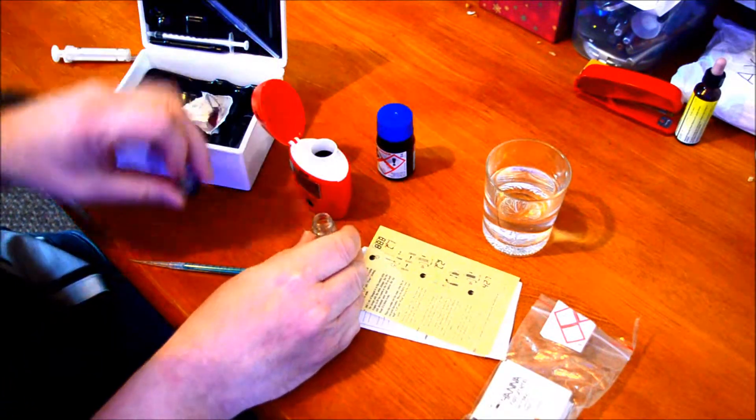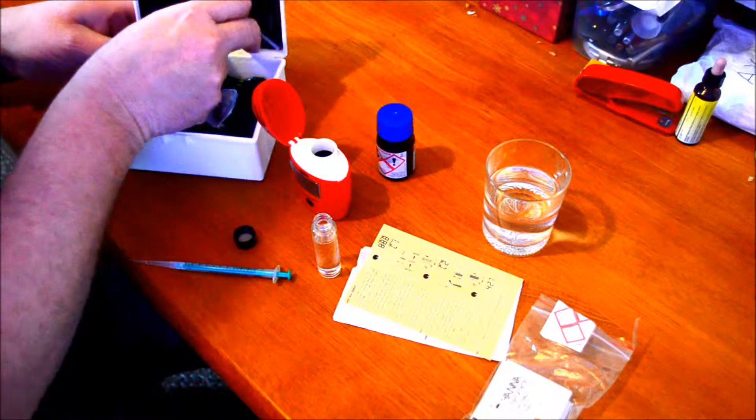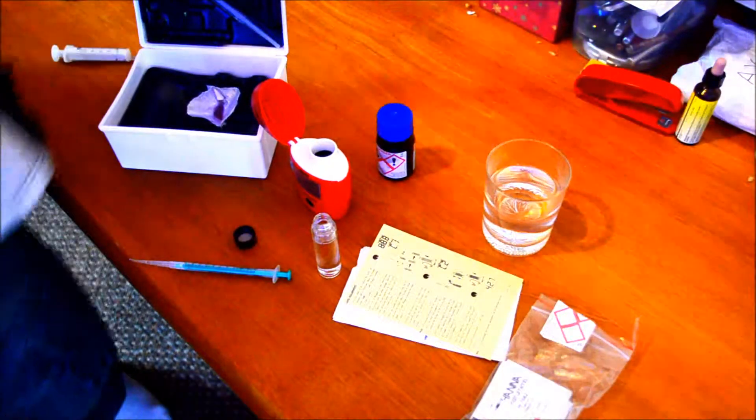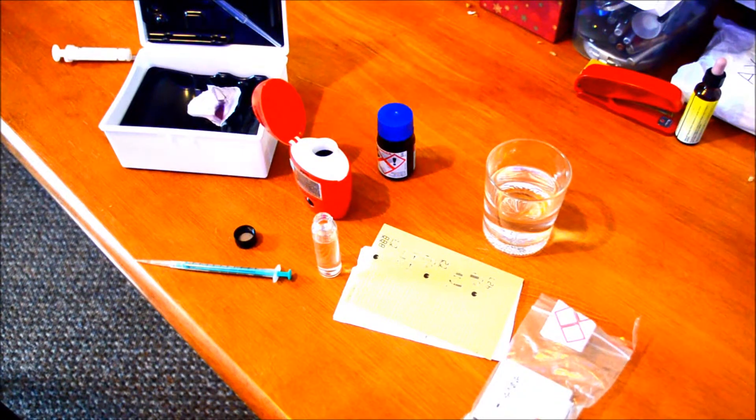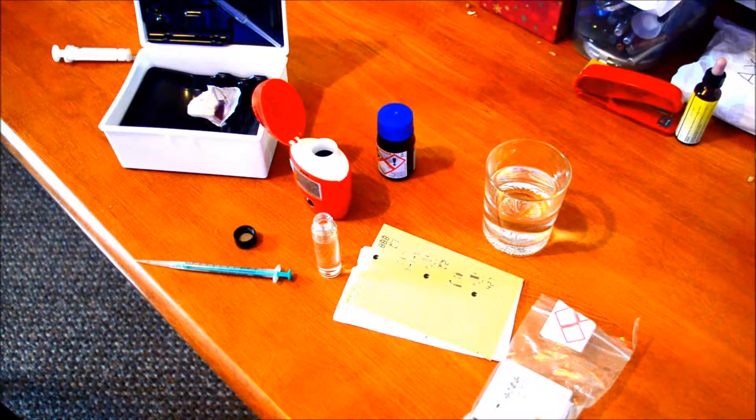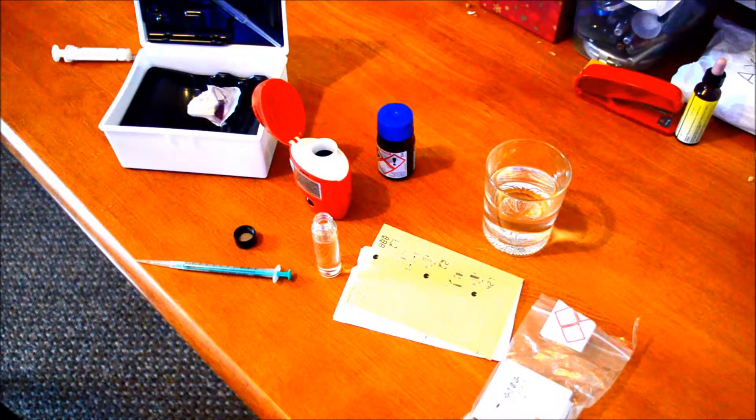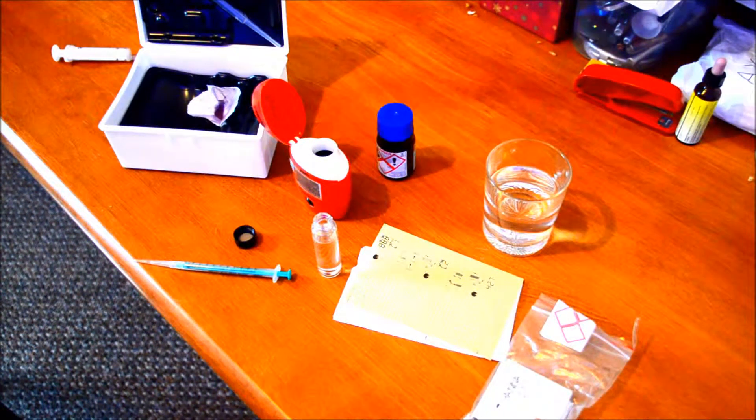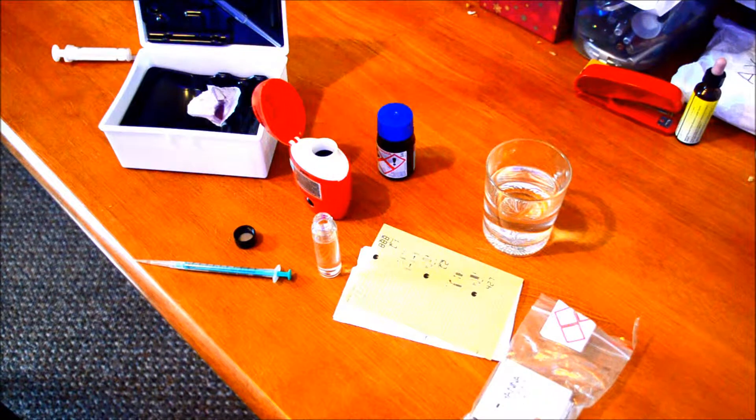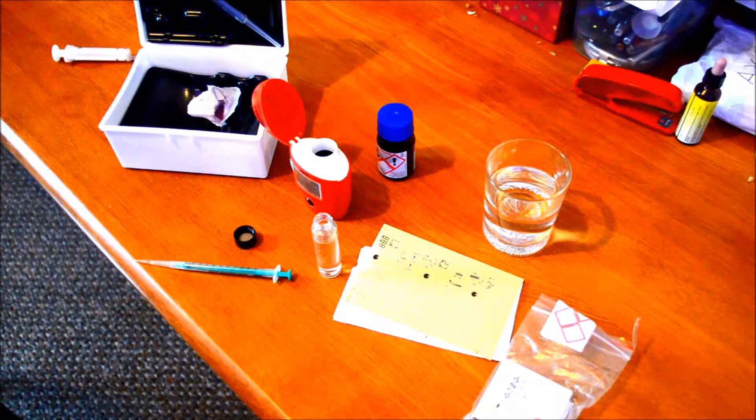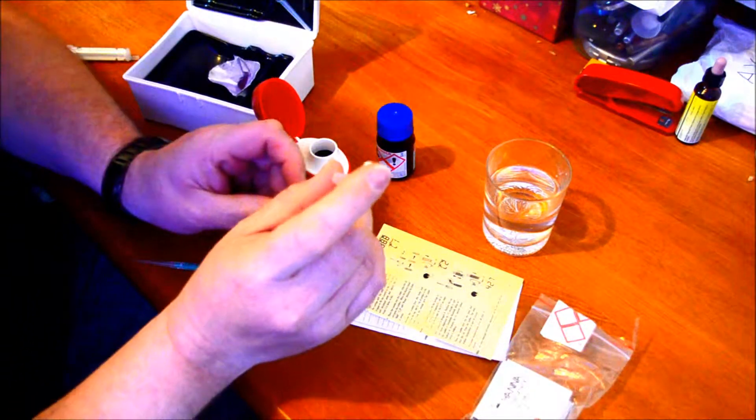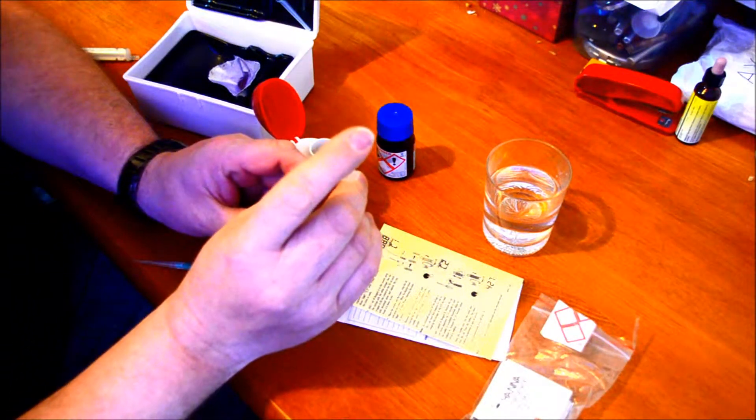In fact, I haven't got some of the water out of the tank, so bear with me a second. I'll just go and get some water. According to the instructions, you add 0.1 milliliter of tank water.